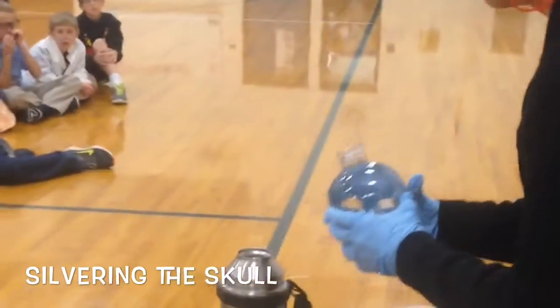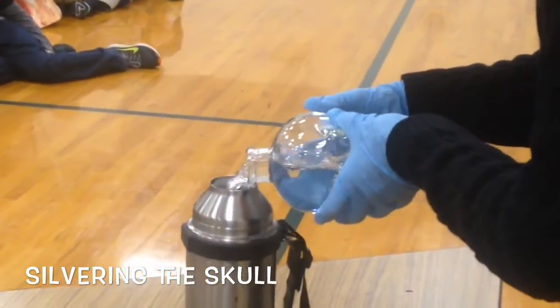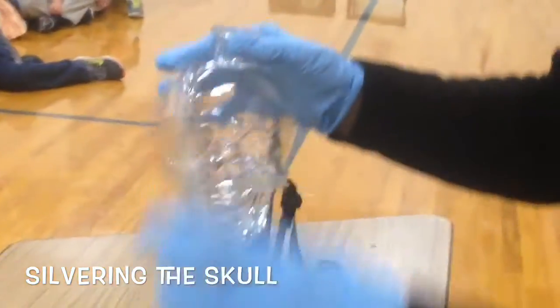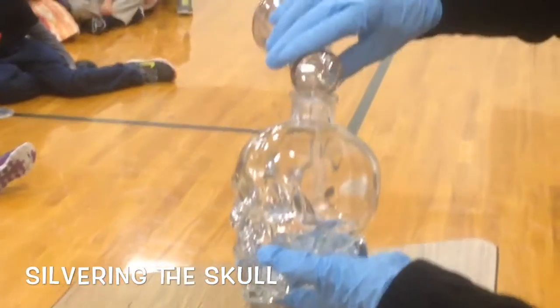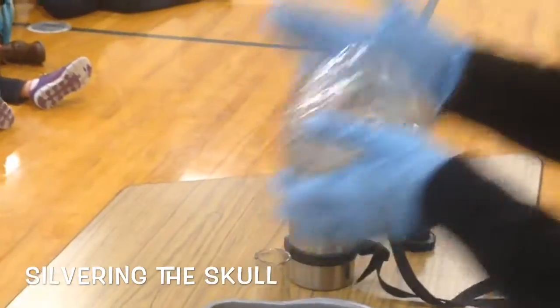This is really hot now, so I'm going to dump the water out. All I did was heat up the glass. And I have another solution that's just sugar dissolved in water. I'm going to add that right to the glass, then dump in the reagent we just made, cover the hole with my hand, and shake it up. Watch what happens.